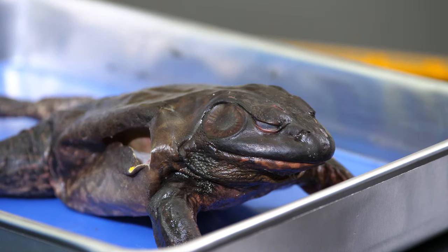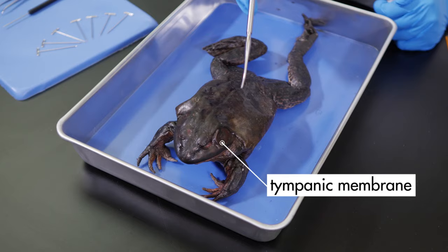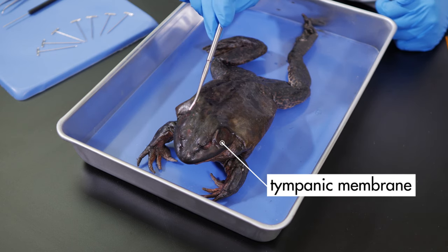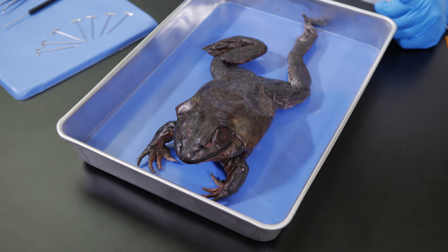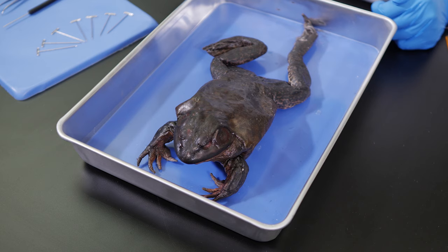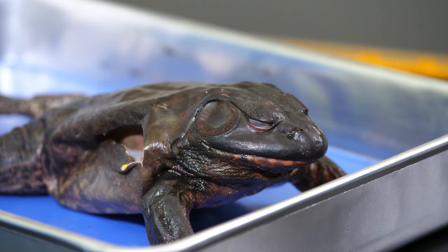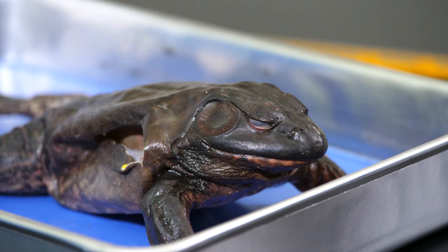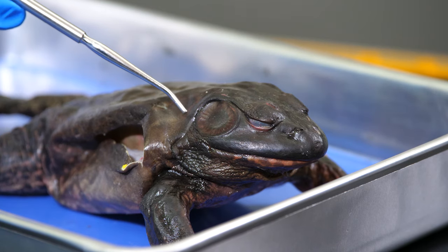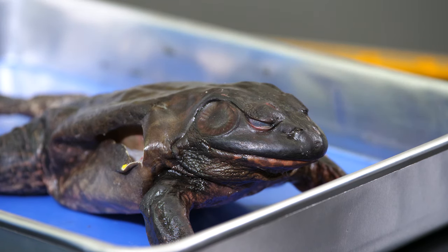Right behind each eye is a round, flat structure. This is the tympanic membrane. A frog uses its tympanic membranes for hearing, similar to the way we use our eardrums. The size of the tympanic membrane is also an indication of the gender of a frog — a male's tympanic membranes will be larger than its eyes, but a female's tympanic membranes will be about the same size as its eyes. Notice that the tympanic membrane on this specimen is larger than the eye. This confirms that this frog is a male.